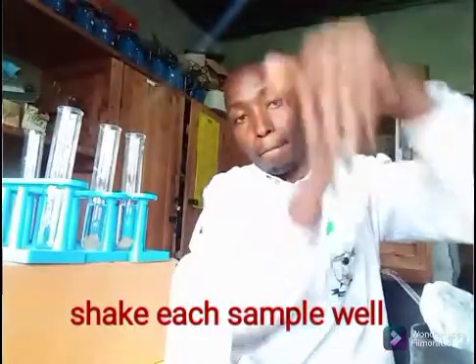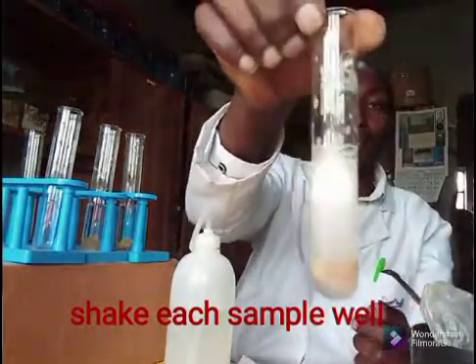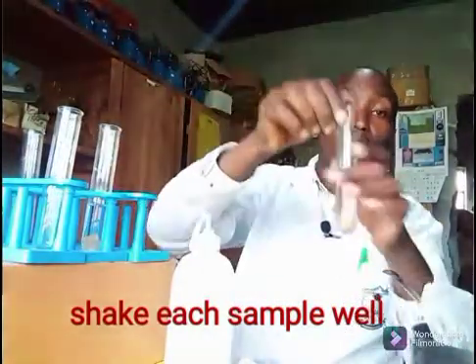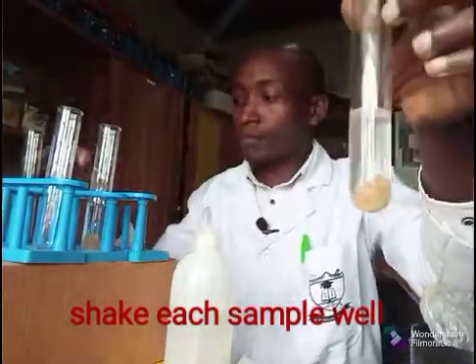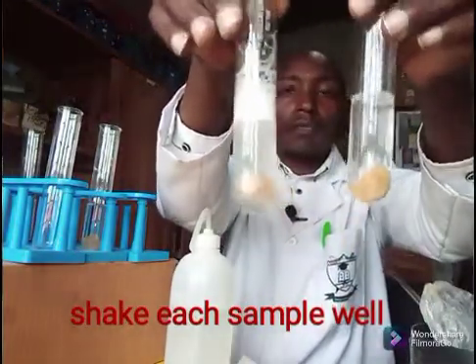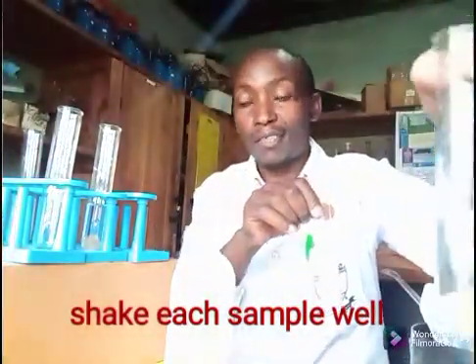Then I'll take and shake each tube. So the first one — that's the first one shaken. Then I take the second one and shake. So far, let's compare the two. This one was without any salt. This one I've added magnesium ions.